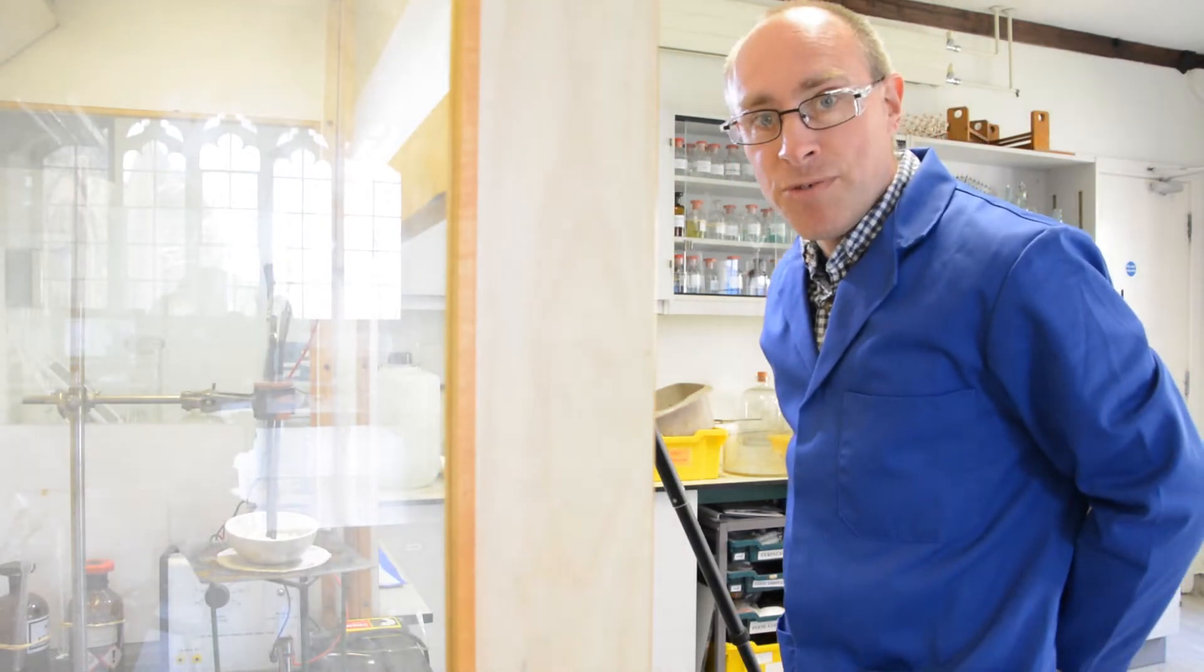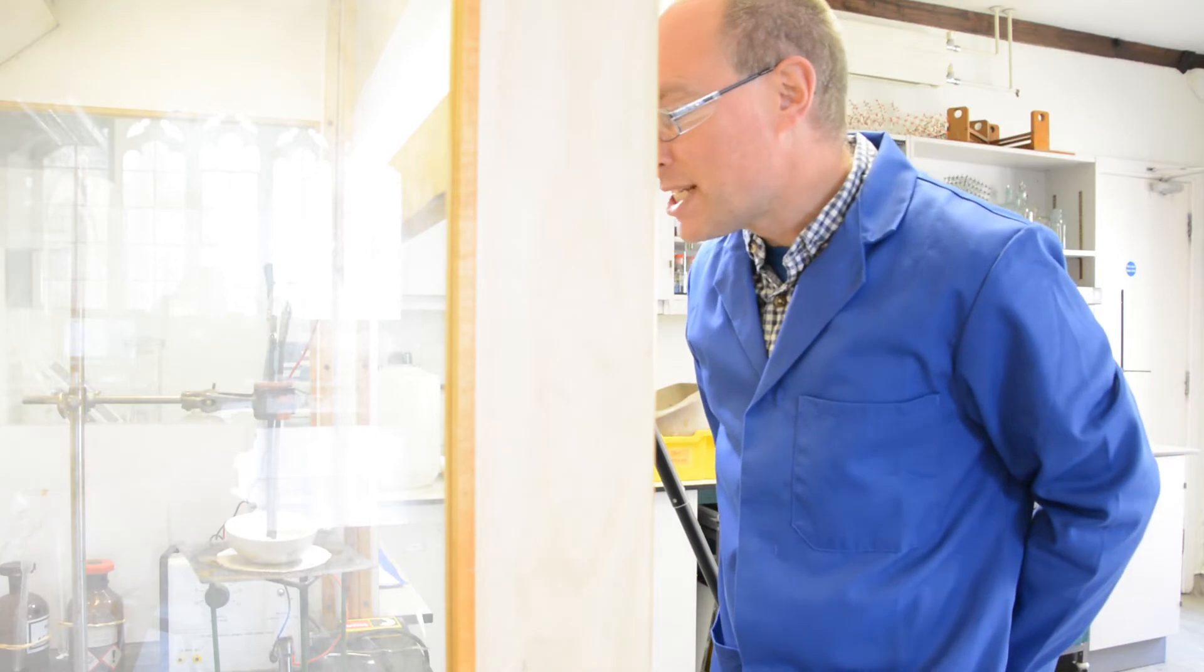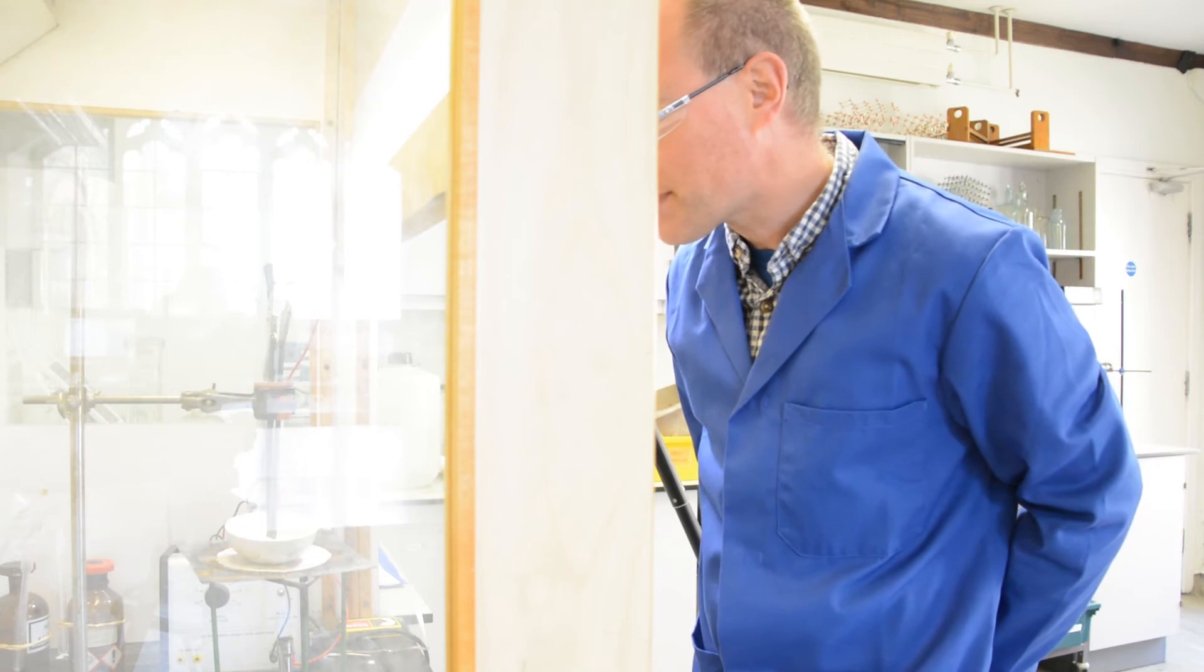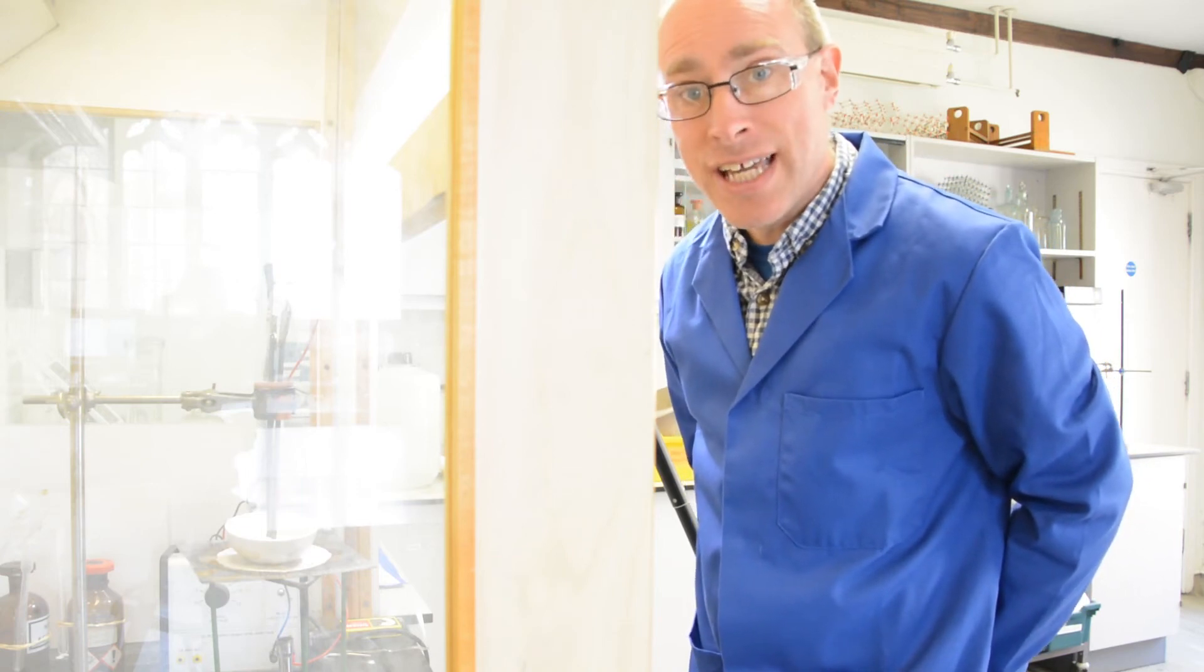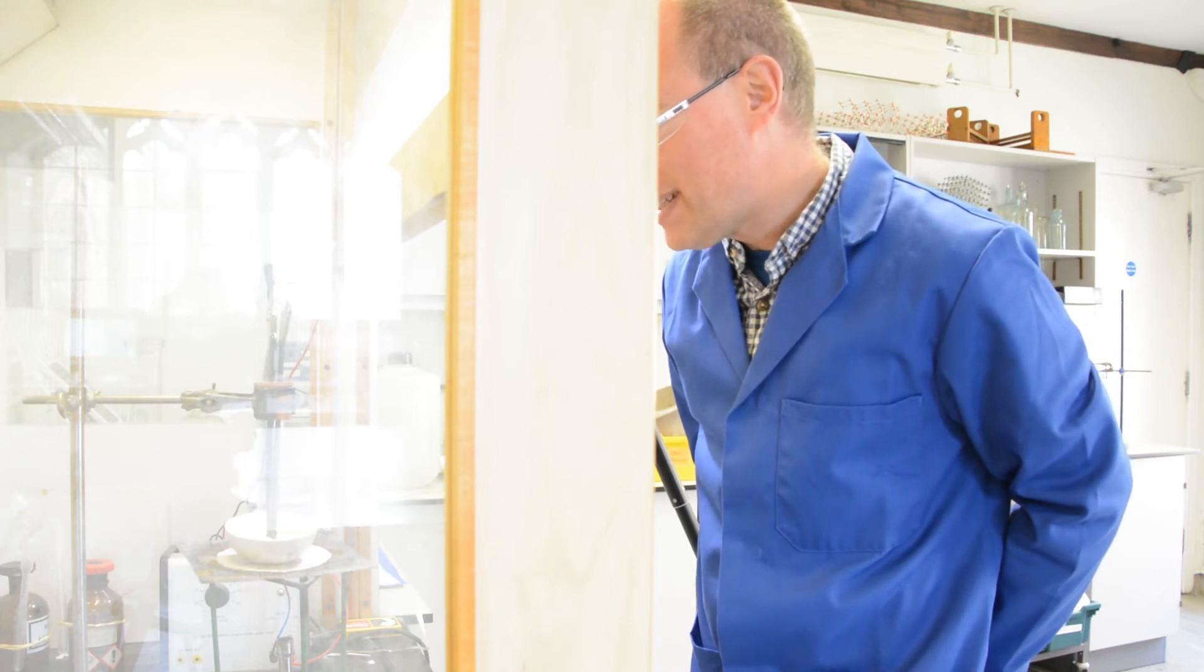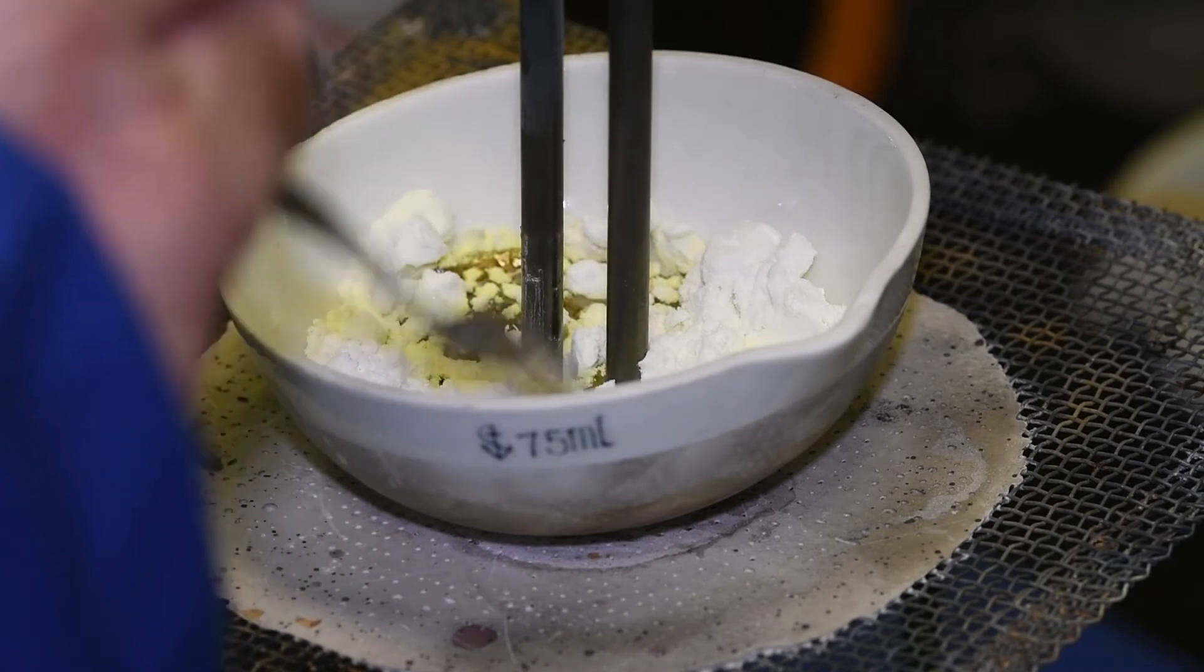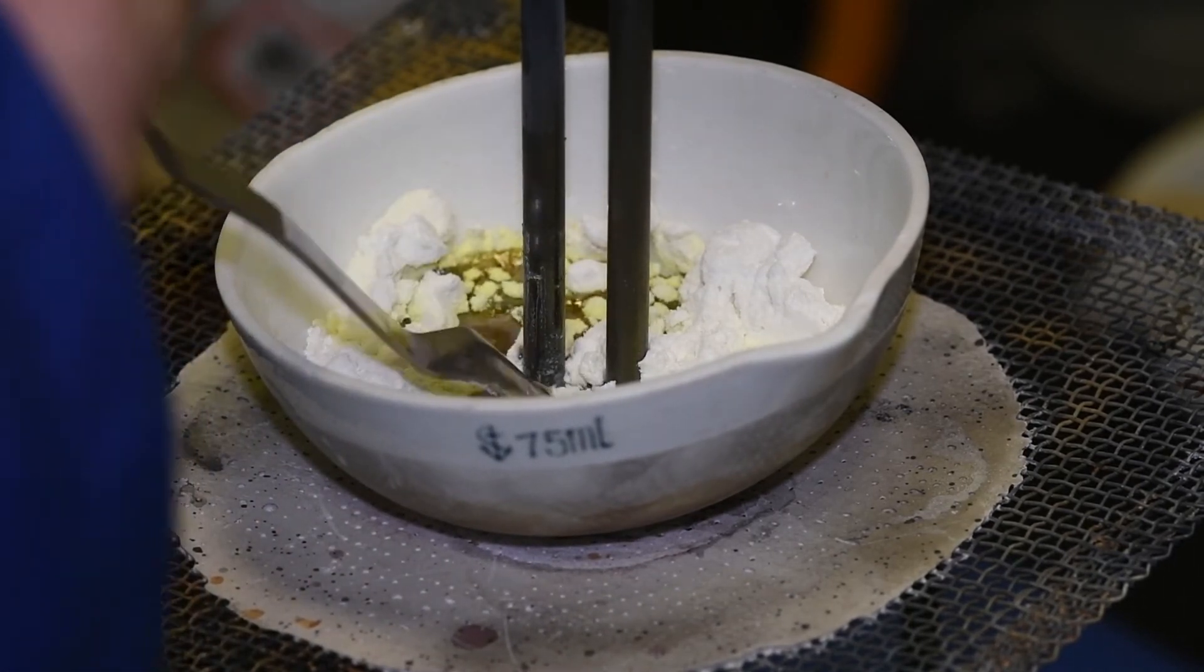So I've turned the fume cupboard on now so it's a little bit noisier, and still waiting for the lead bromide to melt. It's starting to get very hot in there, so it is now just about starting to melt, starting to get some liquid lead bromide in there.